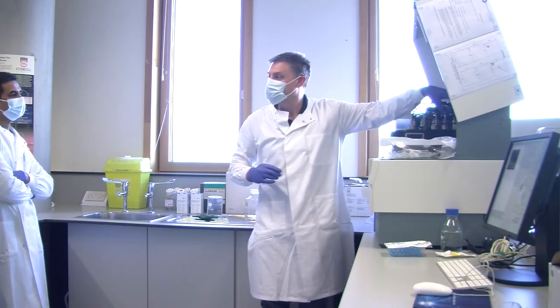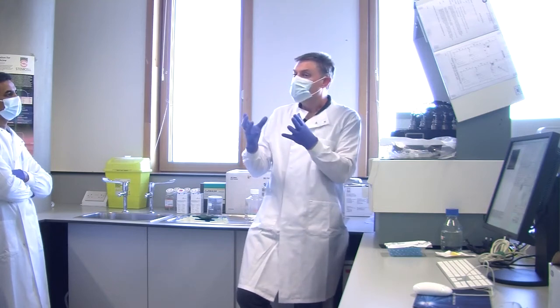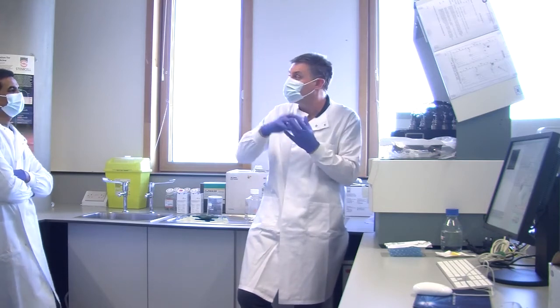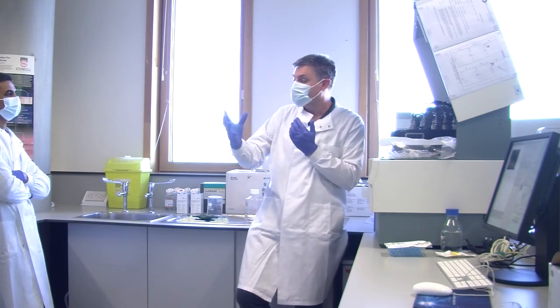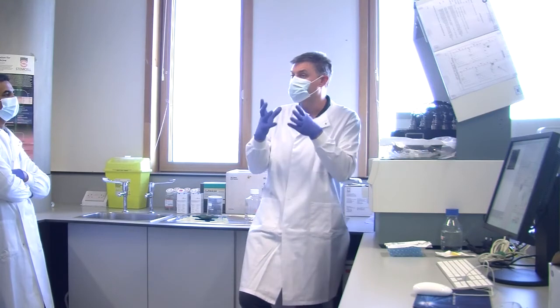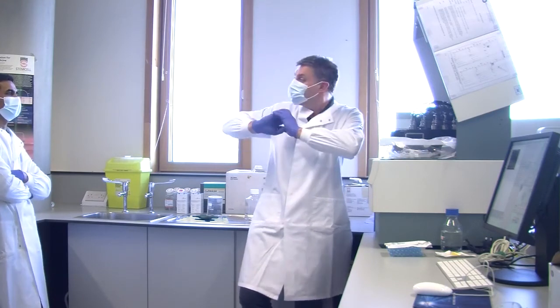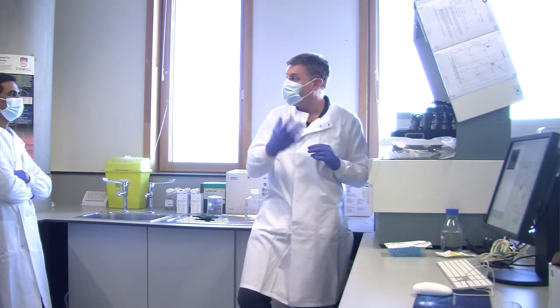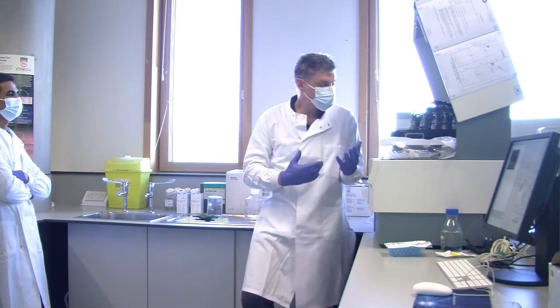The more granular a cell is, the more it will scatter light in all directions, so the more we'll pick up here. If you've got something like an erythrocyte, a red blood cell, that's a bag of protein. That's all it is. There's nothing really granular in there. So the blue light goes straight through and nothing's scattered. You've got something like an eosinophil, a granulocyte, a neutrophil, something like that. That's full of organelles and granules and all sorts. They scatter light in all directions, and we pick up a lot. So a neutrophil has a high granularity, an erythrocyte has a low granularity.